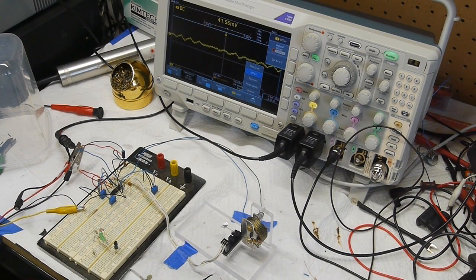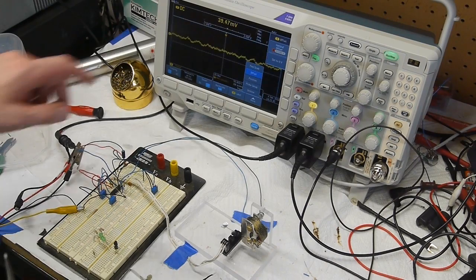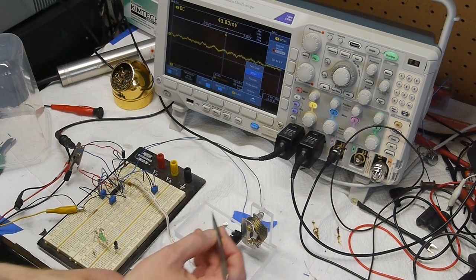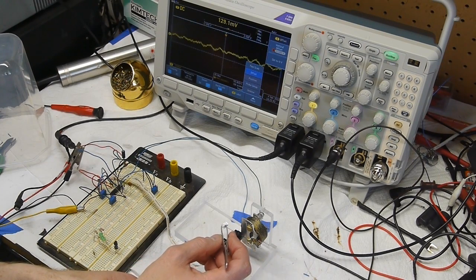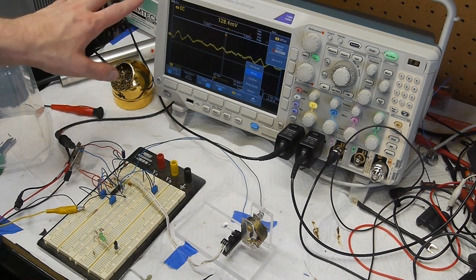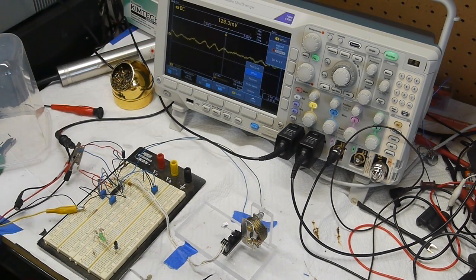So I've cut a 2 by 2 millimeter piece of paper to test the linearity of the system. So 76 micrograms corresponded to about 20 millivolts or 22, so this should be 4 times that. And so we're reading about 45 millivolts. It is kind of wandering quite a bit. Okay, so this is really good. So if the reading here is 125 and we had 45, that's 80, which is exactly 4 times 20. So the system appears to be pretty linear. Okay, so we're back to about 45 millivolts.